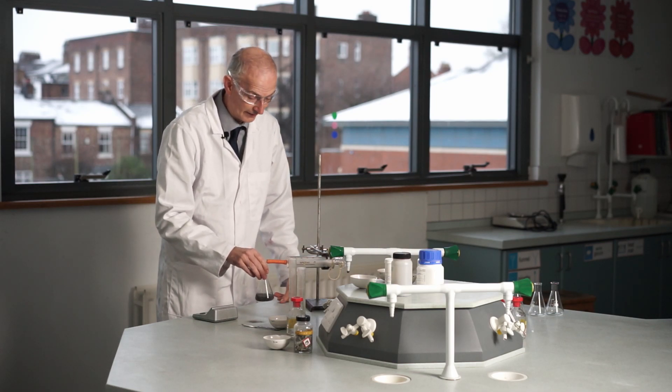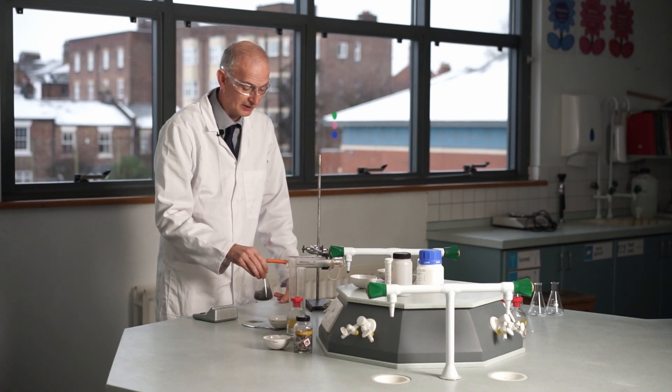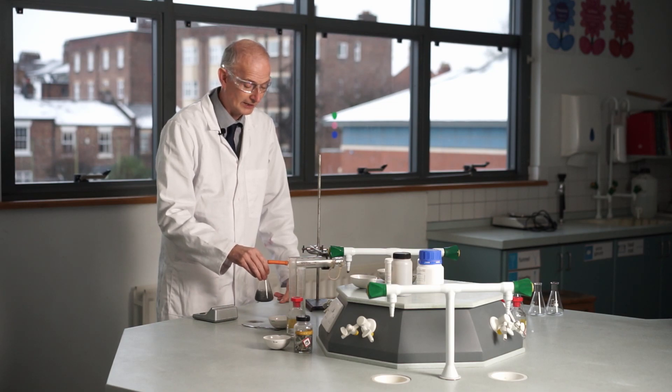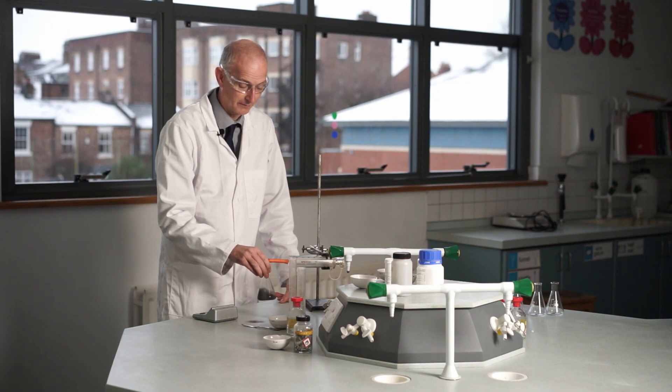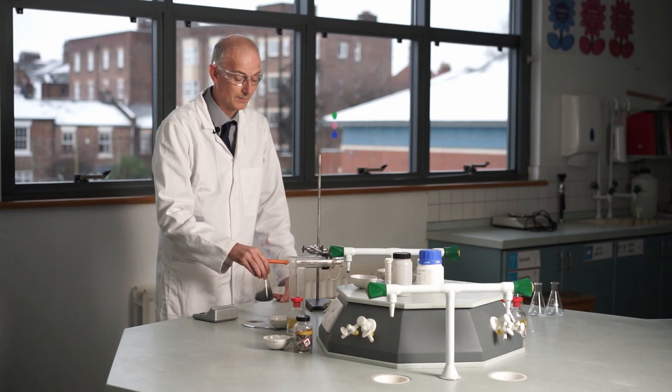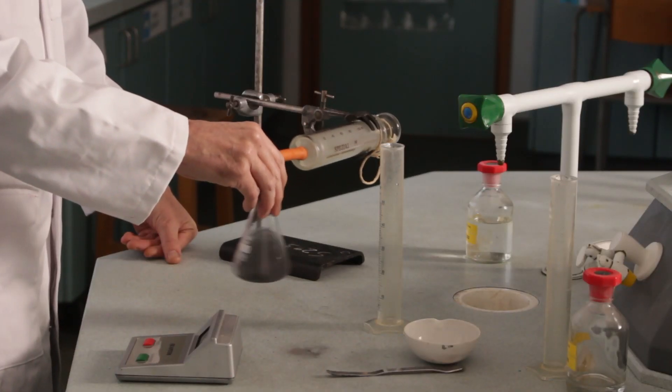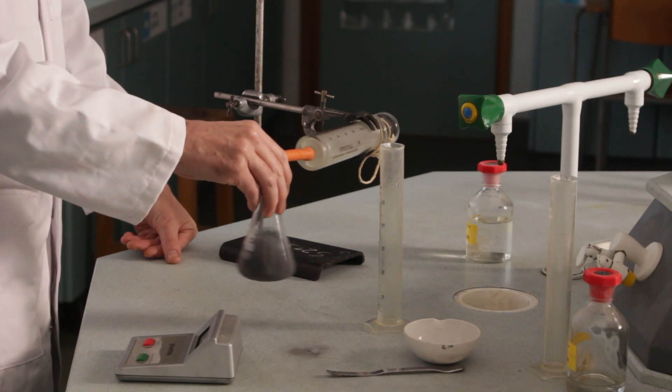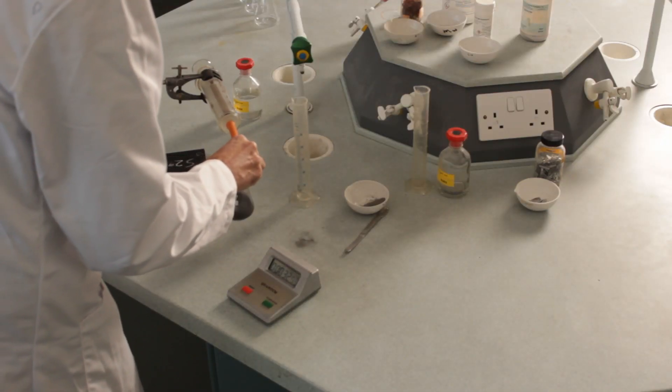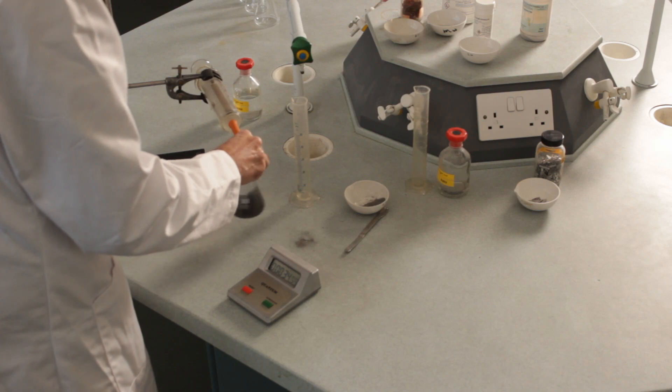Okay, with 10 seconds in and I've made about 5 centimeters cubed of gas already. So I'll keep that swirling process until we reach a minute. And after a minute I'll record the volume. The reaction will still probably be going on, but I'll just record it after a minute. That's 30 seconds gone, and we're about at 10 centimeters cubed of gas.